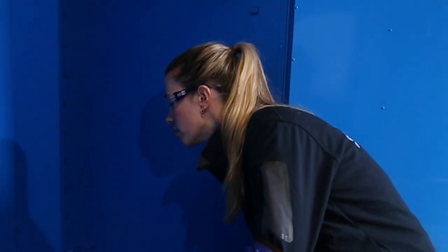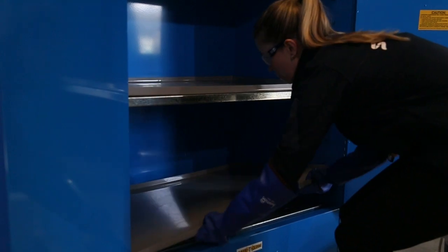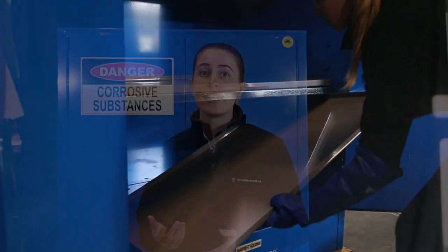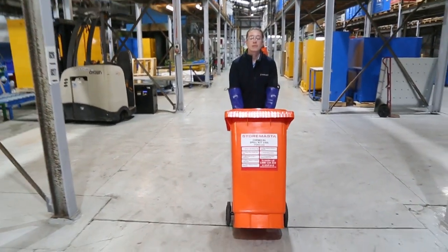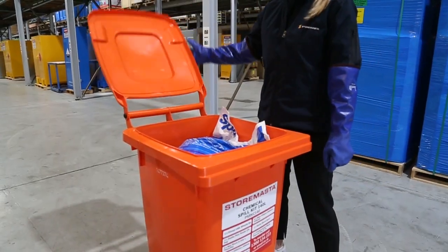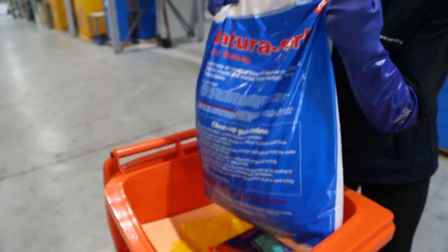If using a polyethylene corrosive cabinet, carefully remove the base shelf of the cabinet and inspect the amount of liquid in the sump. Or if using a metal cabinet, you should have PVC spill trays on the shelves and in the spill sump, so inspect the amount of spillage in the trays. If a considerable amount of chemical is spilled into the sump or tray, consider using the absorbent encapsulating agent or floor sweep in your spill kit to help control the liquid and to reduce the risk of sloshing or splashing while cleaning or removing the trays.